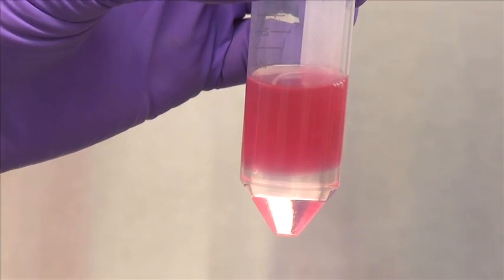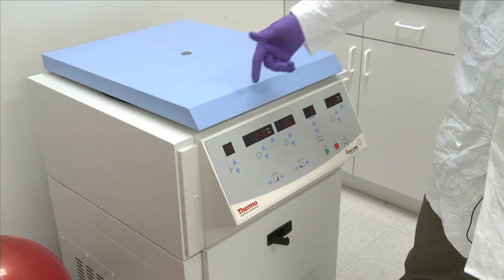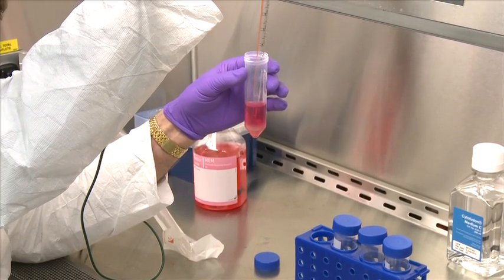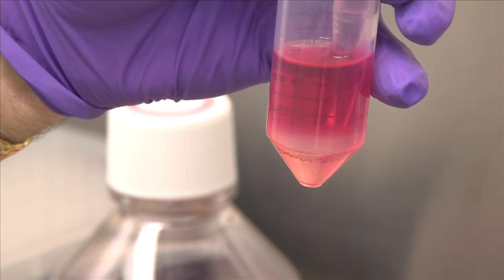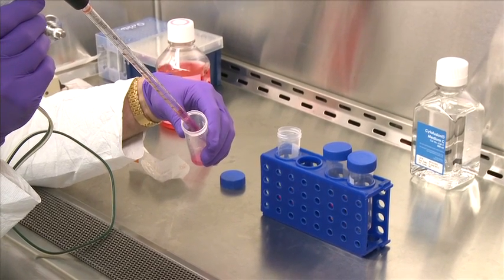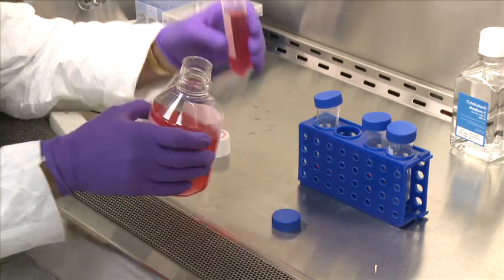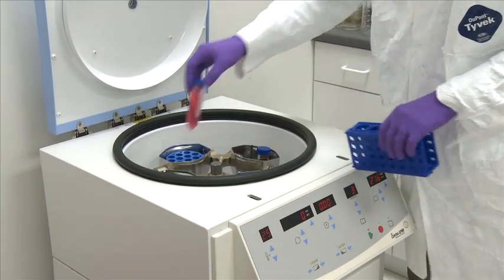Slowly pipette the Ficoll-Histopaque solution into the suspension without forming any bubbles. You should see a distinct layer. Set the centrifuge to 200g at room temperature for 30 minutes. After cells have been centrifuged, using a sterile transfer pipette, insert the tip until it touches the buffy coat layer containing the B cells. Transfer the cells to a new conical tube.